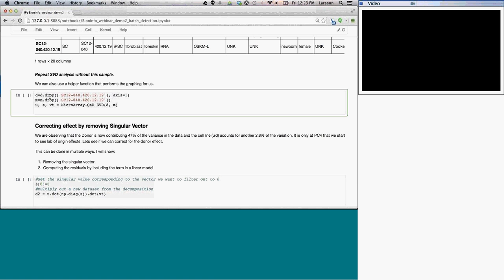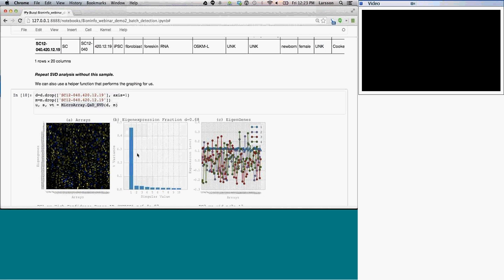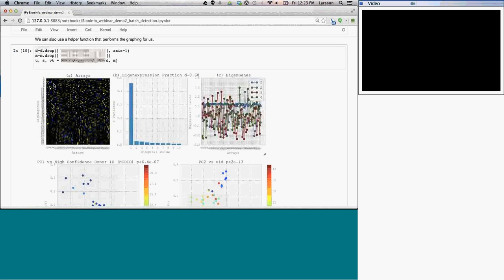And here I have a convenience function that I have written, and I can share that as well, which basically does the same step as above. It does the singular value decomposition, but it also looks at the covariates and finds, for each singular vector, which ones are the most correlated with it. If I run this, it takes longer because it does a little bit more work, and it creates a bunch of different figures. The first figure right here is this V transpose matrix. So this is all the singular vectors that we would be looking at.